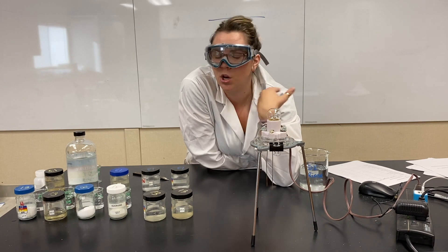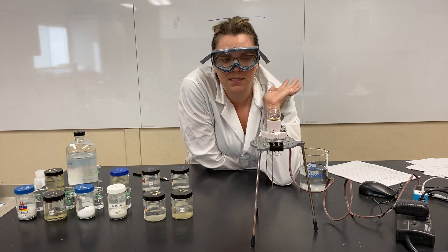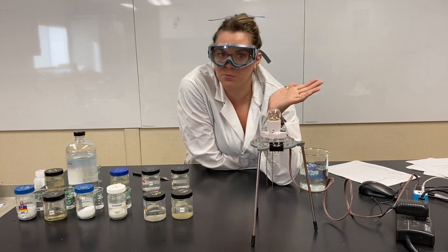Non-electrolyte, no electrical conductivity. Now we just test a bunch of stuff and see if the light lights up. That's pretty much it.